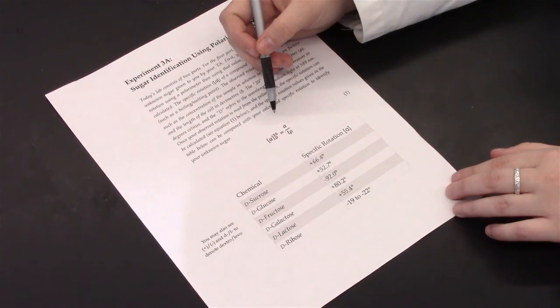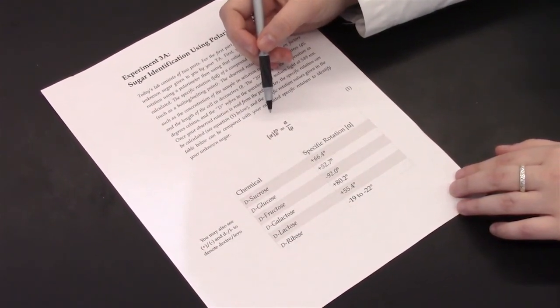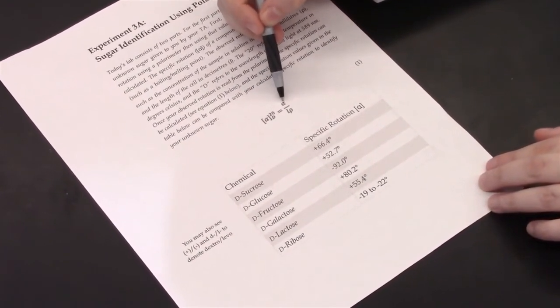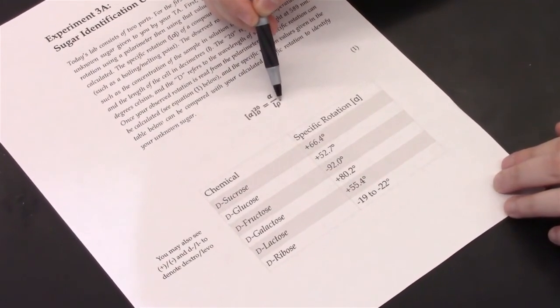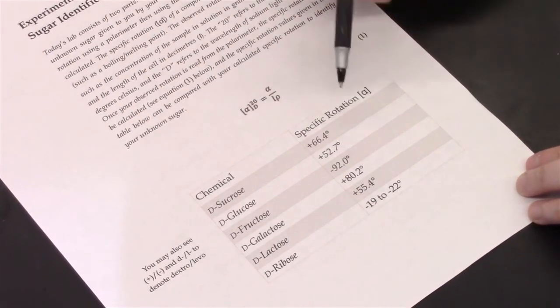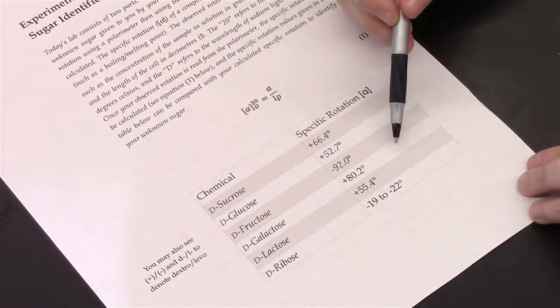When you find your observed optical rotation value, you are able to solve for the specific rotation using equation 1. Divide this observed optical rotation value by the concentration of your solution and the length of the tube. This final optical rotation reading can be used and compared to known literature values to determine what the compound at hand is.